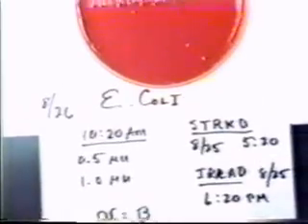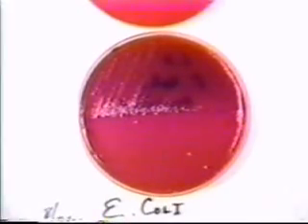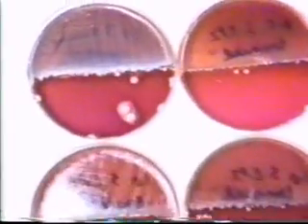Close up, a clear delineation is shown between the area that was irradiated and the area that was shielded. These petri dishes, streaked with E. coli and checked after approximately 16 hours, show virtually no growth after irradiation. Clear delineation is evident between the irradiated and non-irradiated areas. These are the same Staphylococcus cultures approximately four days after having one half of the dish irradiated, showing heavier growth of the bacteria in shielded areas and a slight growth beginning in the irradiated areas.